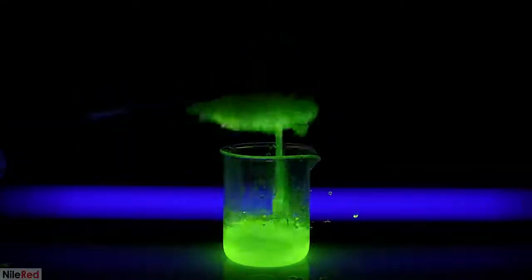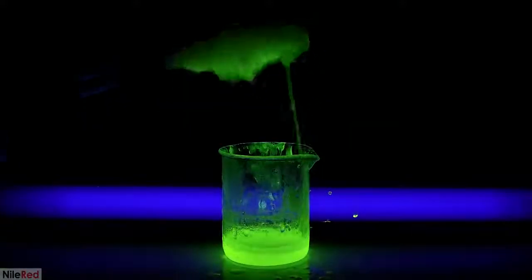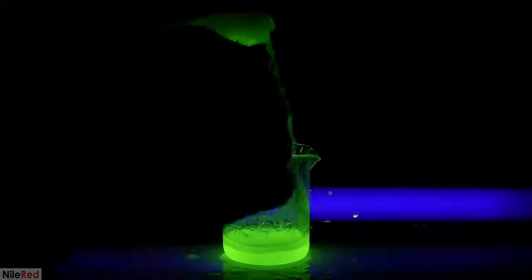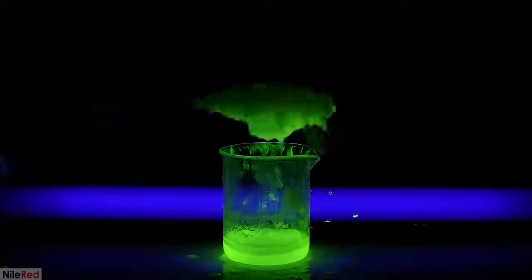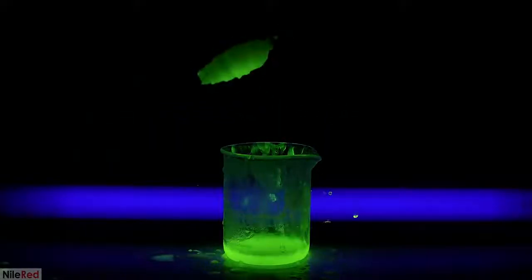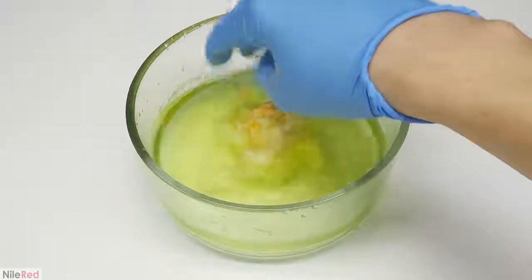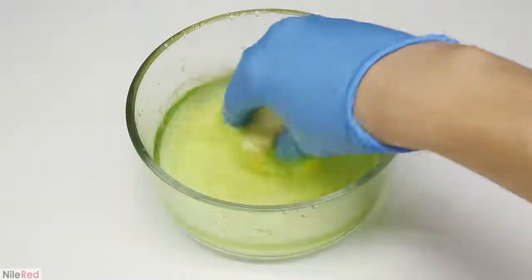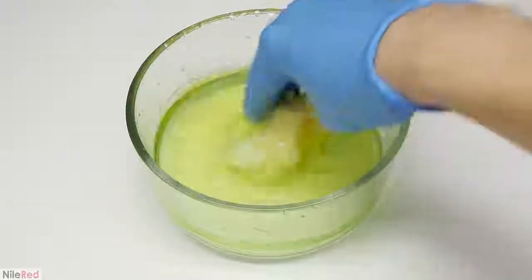Near the end, it got super messy and was pretty gross looking. I ended up having to transfer the huge messy blob and restart with a fresh glass rod. The nylon from all of the runs was combined in the same bowl and given a thorough washing. Mixed with the nylon is a lot of unreacted adipoyl chloride, hexamethylene diamine, and also the fluorescein that I added in.